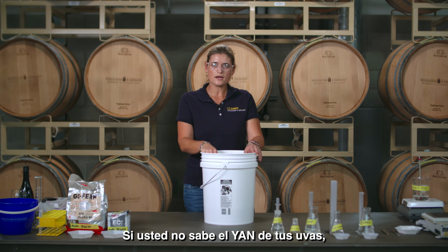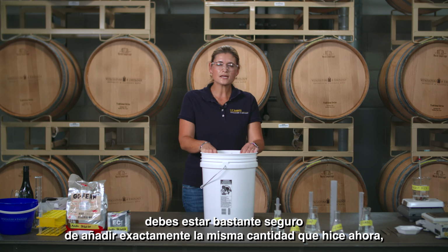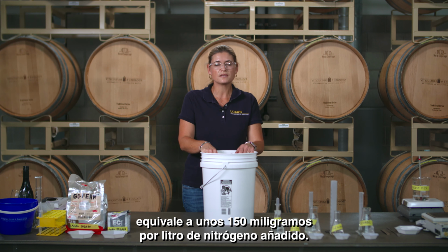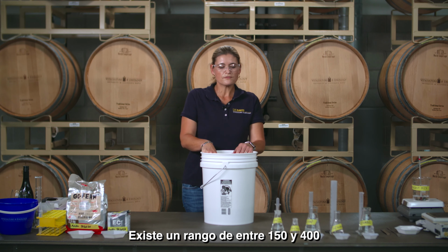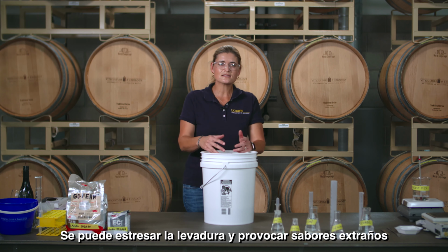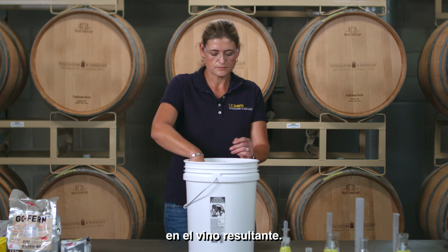If you do not know the YAN of your grapes, you don't know how much nitrogen is in there, you're pretty safe adding exactly the same amount I did. Now, 23.3 milliliters of a 10% DAP solution is about 150 milligrams per liter of nitrogen that you added. That's the minimum amount any yeast needs. You have a range of between 150 to 400. If you add too much nitrogen or if you have too little nitrogen, that can stress the yeast and it can cause off flavors in your resulting wine.